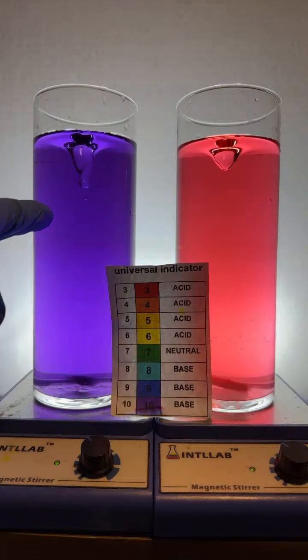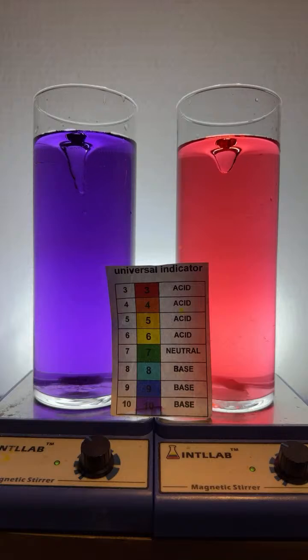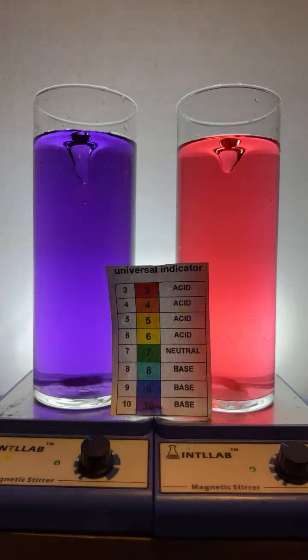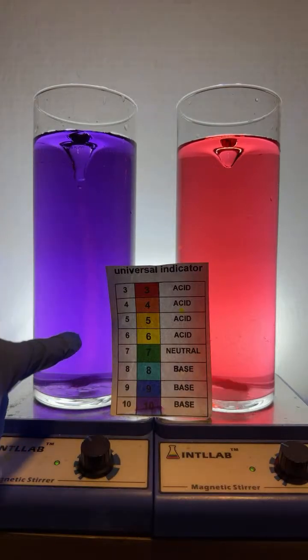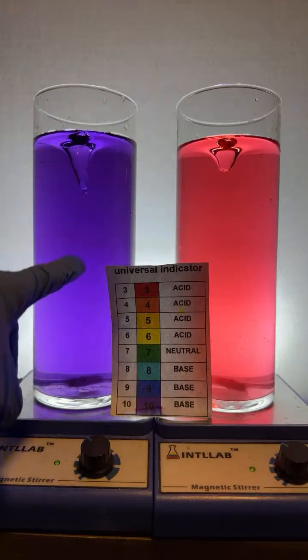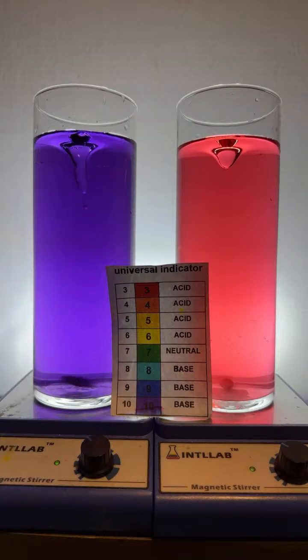Now, I'm going to go ahead and try to neutralize this base. I'm going to do that by adding drops of acid. So over here on the left, let's add 1 drop of acid. See what happens. If you look carefully, you can just see a little bit of red color develop there down the center of the vortex. And it looks like the base completely consumes the acid that's been added.